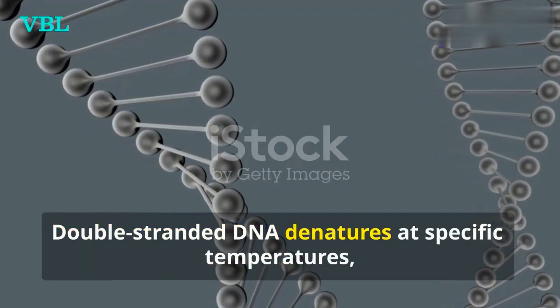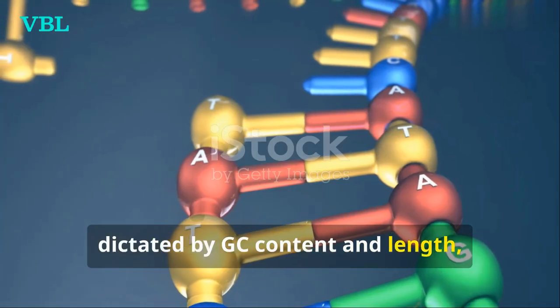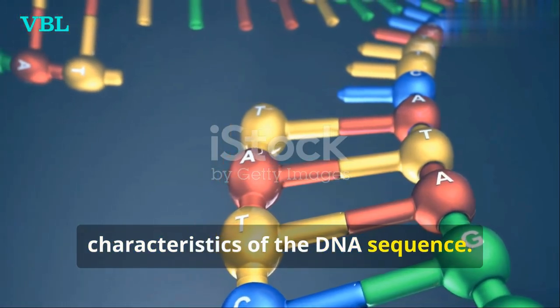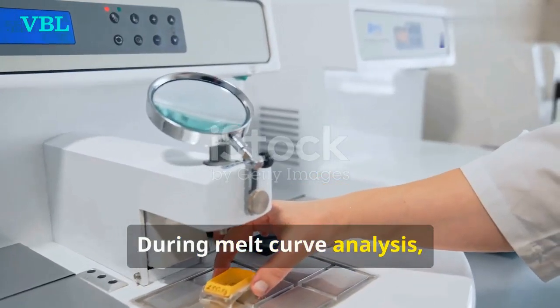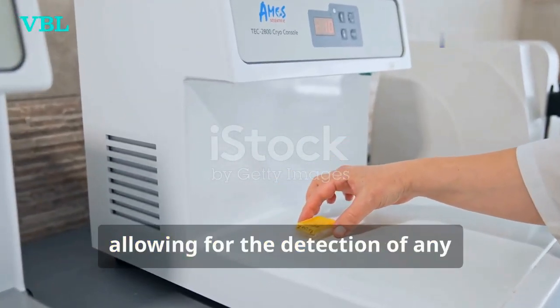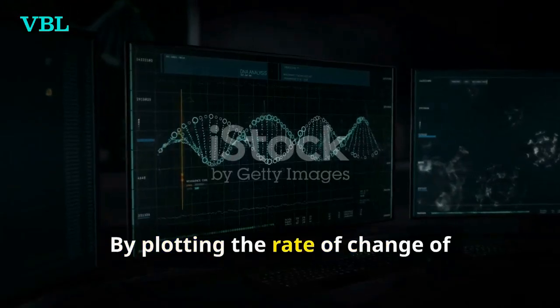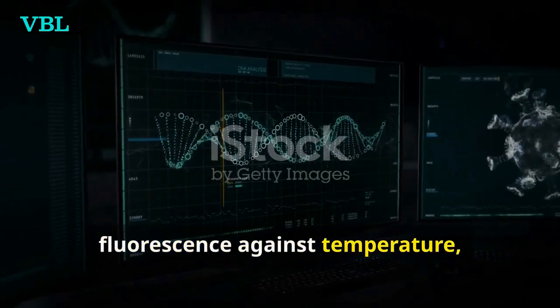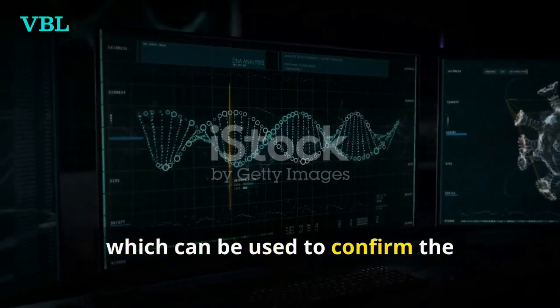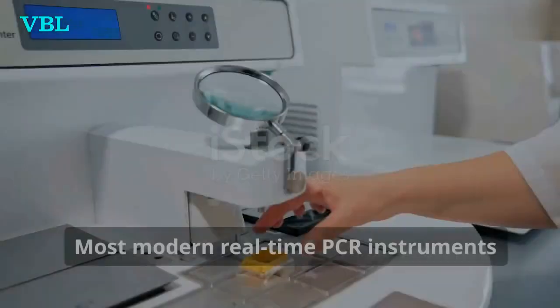Double-stranded DNA denatures at specific temperatures, dictated by GC content and length, which helps in identifying the unique characteristics of the DNA sequence. During melt curve analysis, the temperature is gradually increased and fluorescence is monitored, allowing for the detection of any non-specific products. By plotting the rate of change of fluorescence against temperature, a characteristic melt curve is generated, which can be used to confirm the specificity and efficiency of the qPCR reaction.